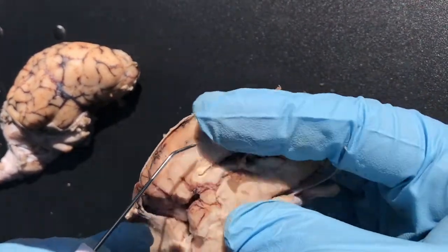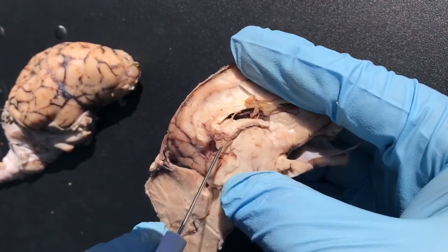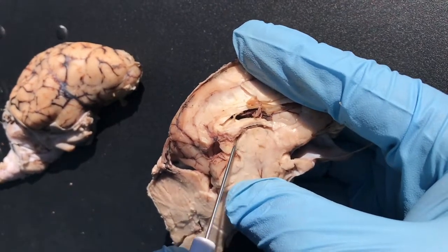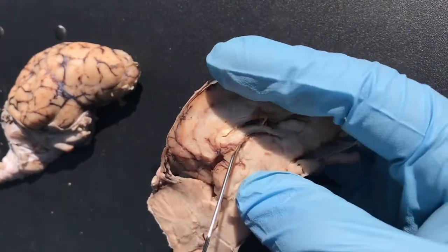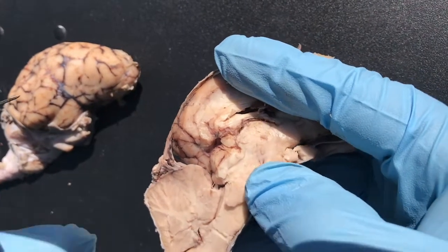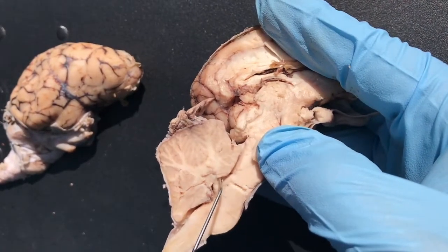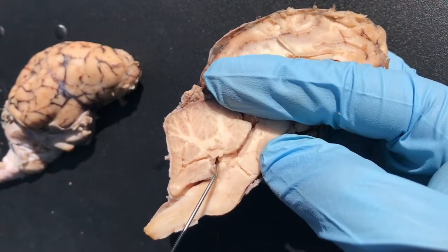And below the fornix, then we see here's the thalamus. This is the thalamus. And the cavity that's going around here is the third ventricle. And you can follow the third ventricle around, down the cerebral aqueduct — a little hard to see. And then finally, as you go around, you have this little pocket right here — this is the fourth ventricle.